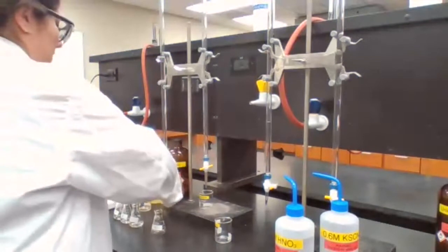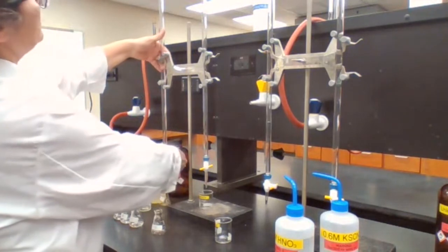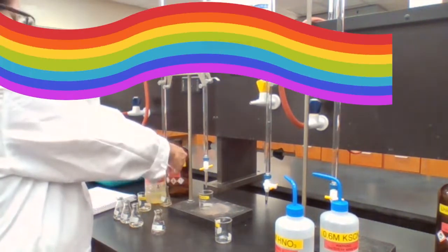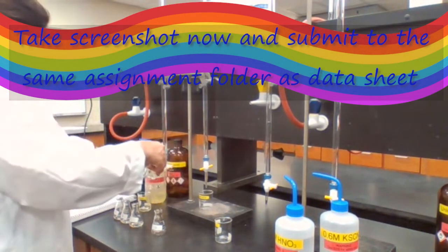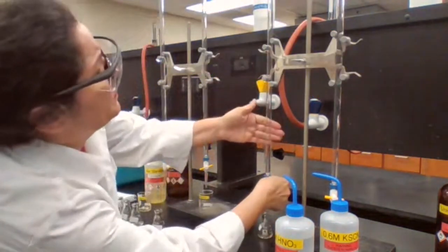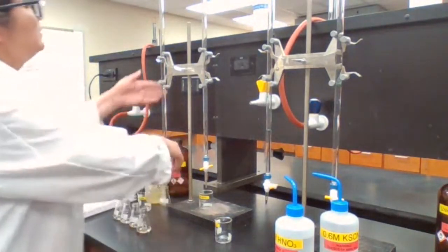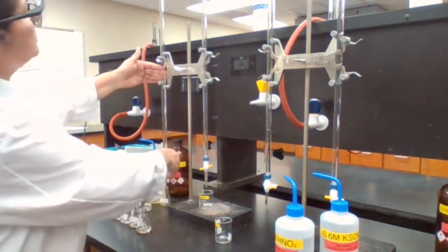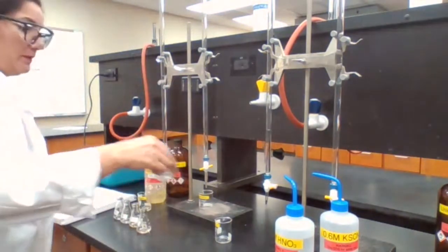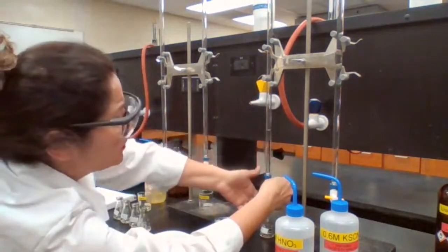For flask D: three milliliters of iron, going from 21 to 24, and two milliliters of nitric acid. For flask E: four milliliters of iron, going from 24 to 28, and one milliliter of nitric acid, going from 43 to 44. All flasks are ready with the exception of KSCN.